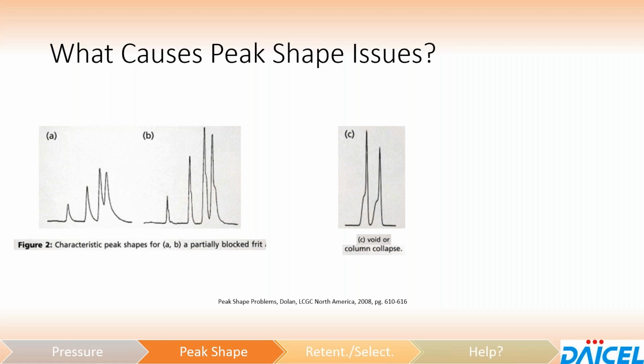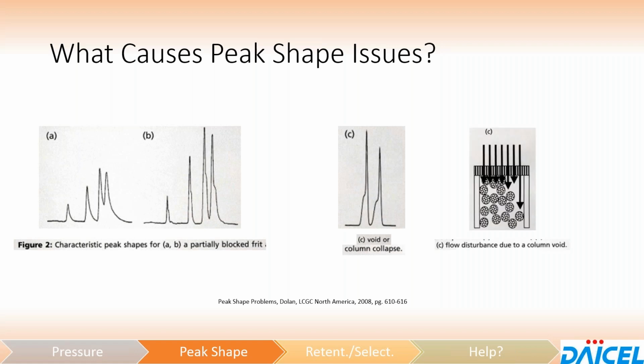And again, if we look at a diagram of what's happening in the column itself, it makes sense. You're going to have a void potentially that has formed at the inlet frit. You've got a portion that's coming through in your main slug, so your main sharp peak here. Then you also have a portion that's going to be flying through much faster than the rest of it. So you have a small portion and then it comes out as a shoulder in the front.